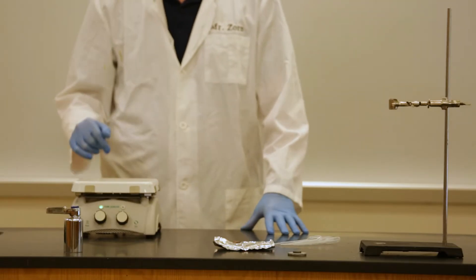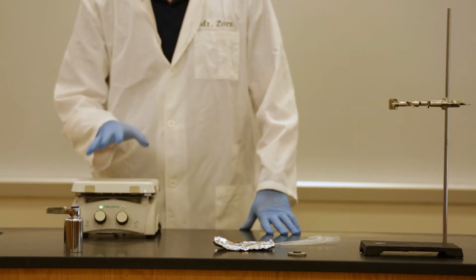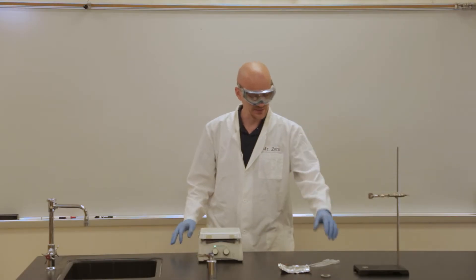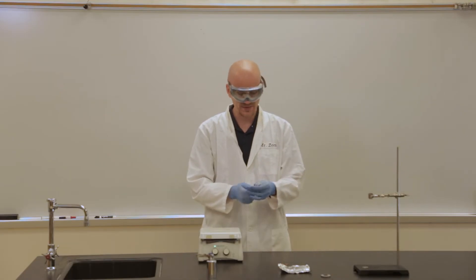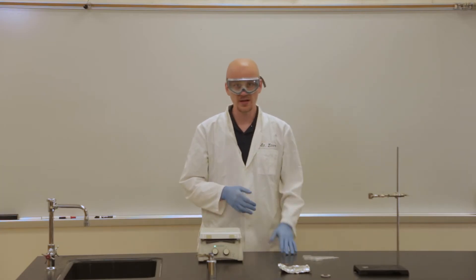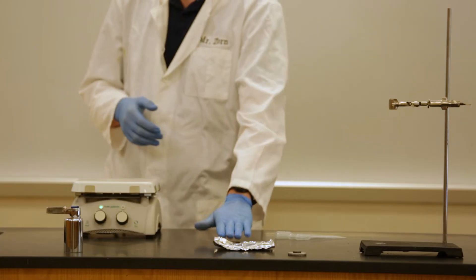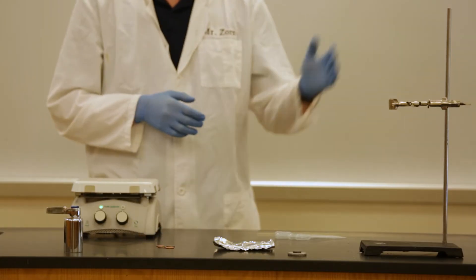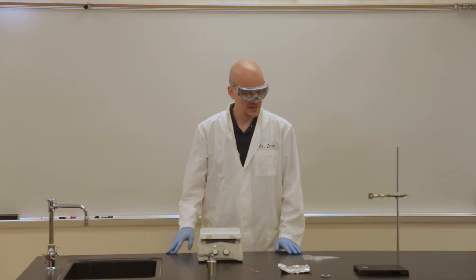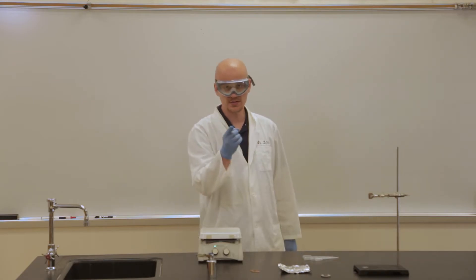First thing we need to do is plug in our hot plate and get that going because that's going to be one of the first things we use and we need it to be hot. Other things we're going to need for this lab activity are some pipettes, some aluminum foil — we're going to make a boat similar to what we did in one of our previous labs — some pennies, test tubes, and that's about it. It's a relatively simple, straightforward lab, so let's get to it.